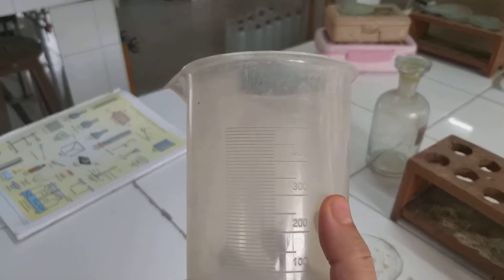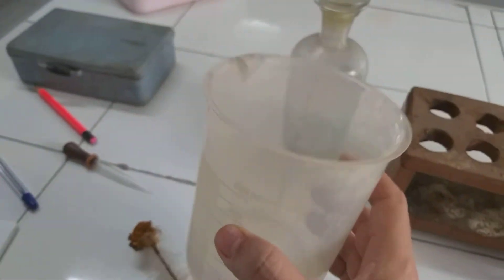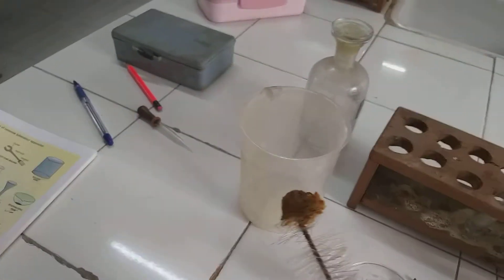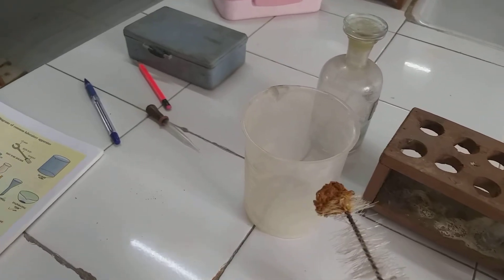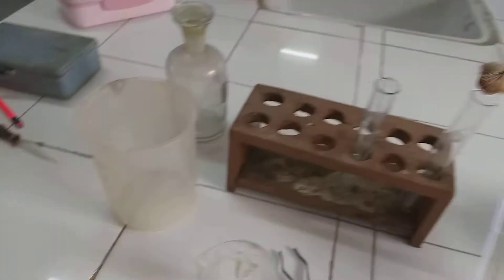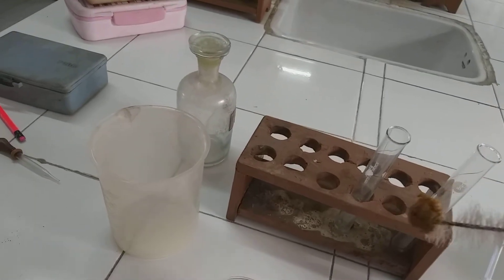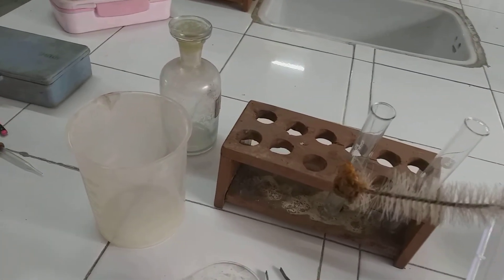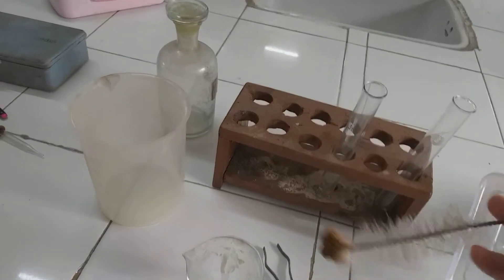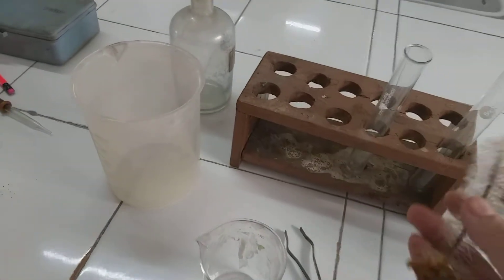Graduations are present till 500 ml, so this is also used for measuring various volumes of liquids. Now this is a test tube brush. We just put it inside the test tube, completely inside.